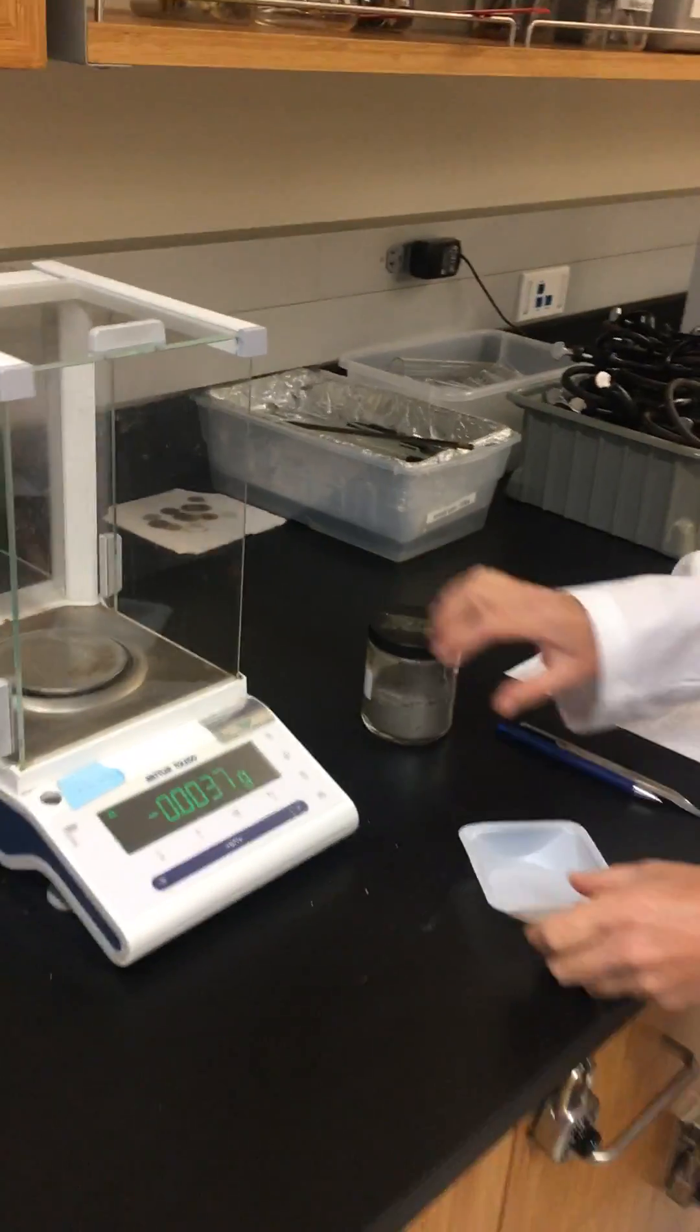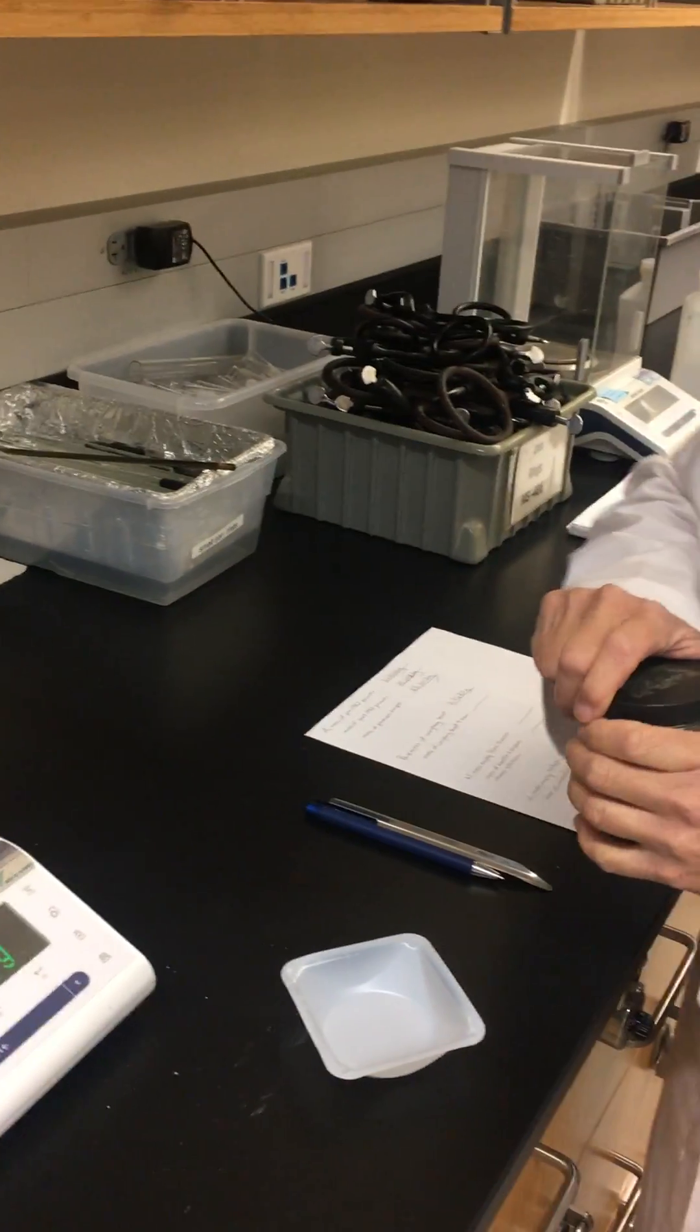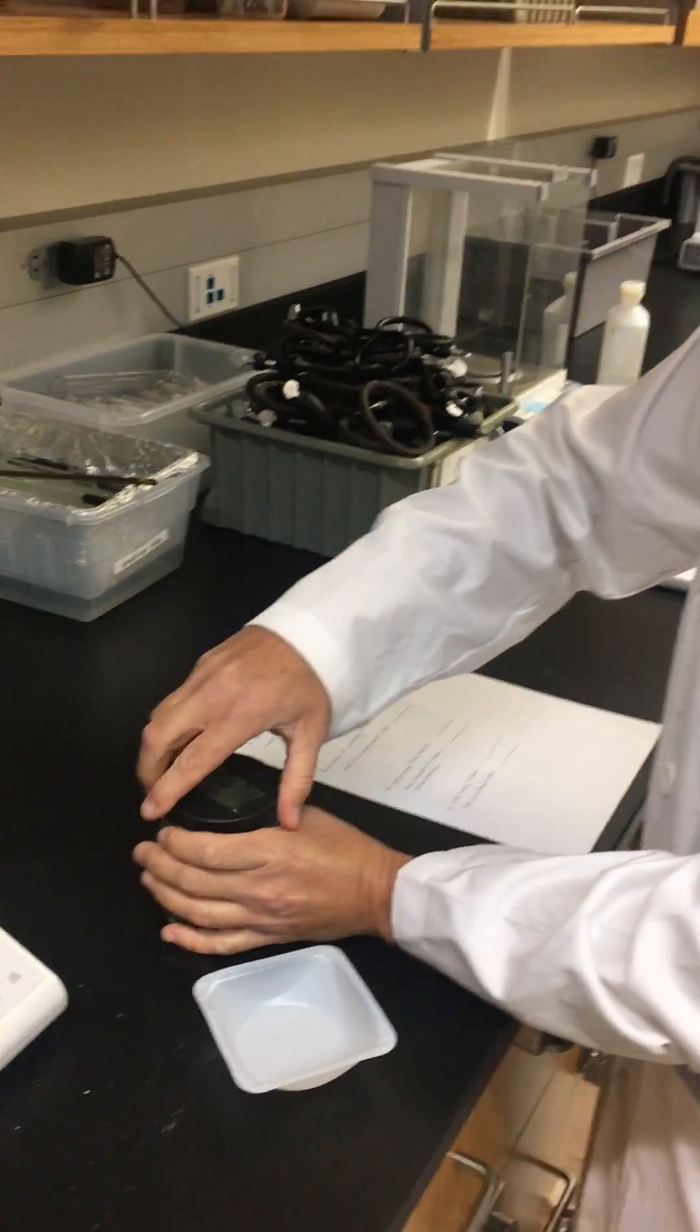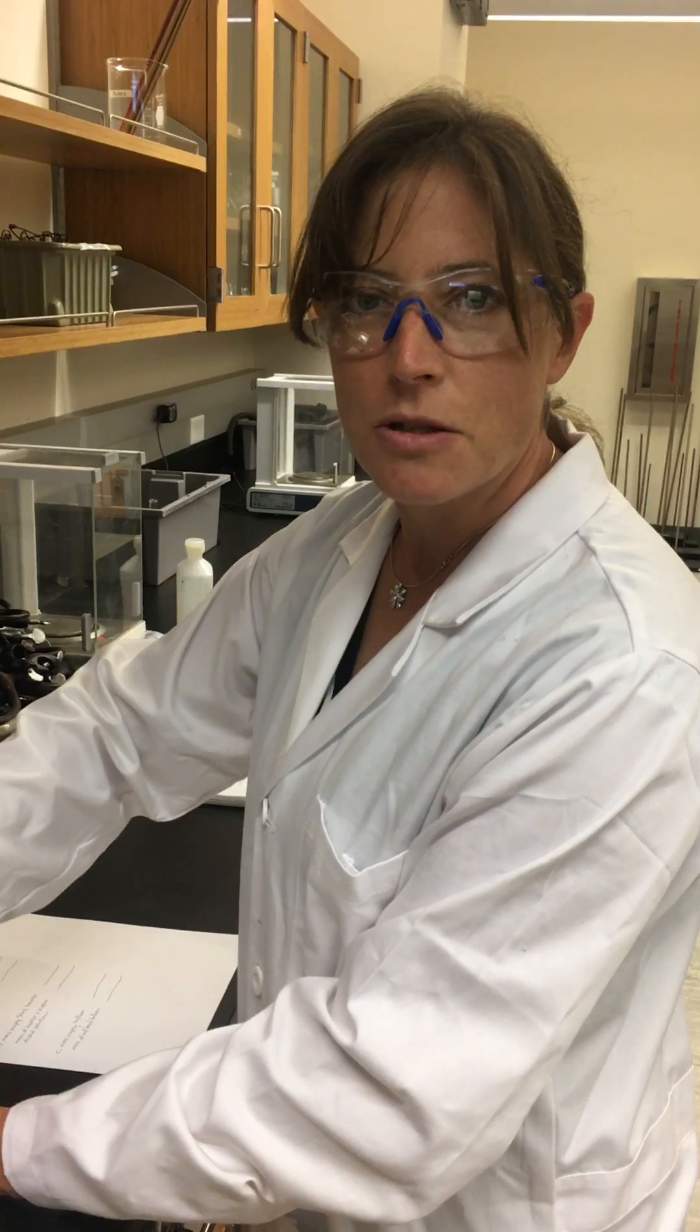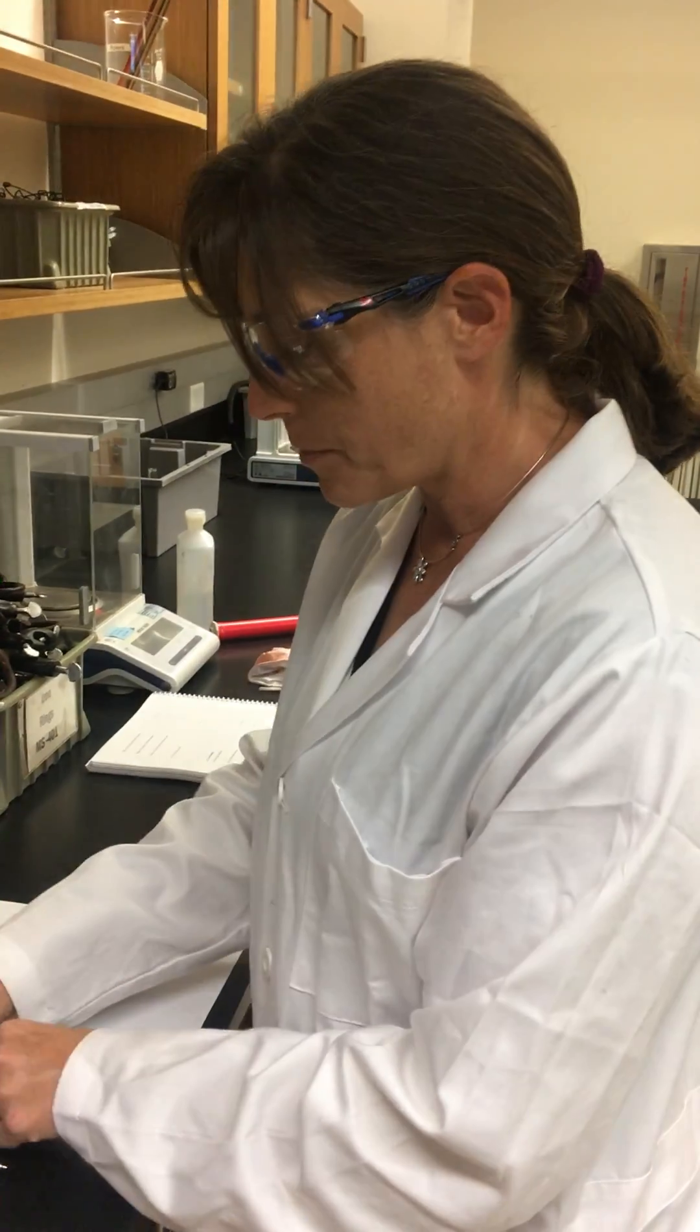Okay, so now we're going to add a sample of iron. In your lab manual it says to add about 5 grams. But the mass is not important. We just need a mass so we can calculate how many iron atoms are in this sample.